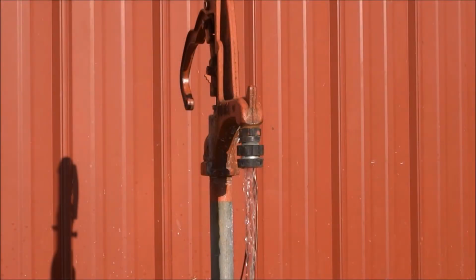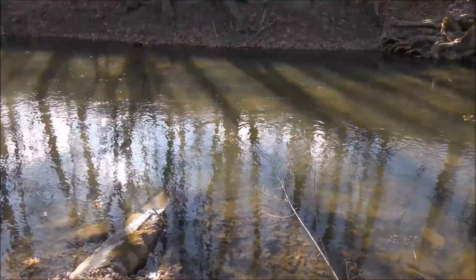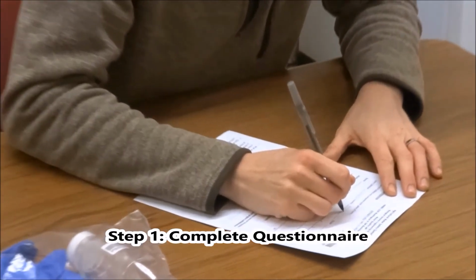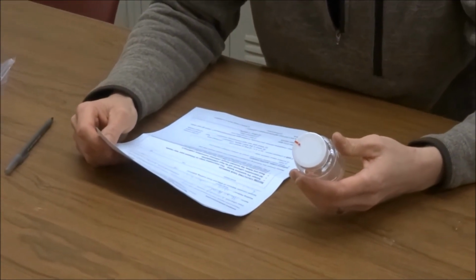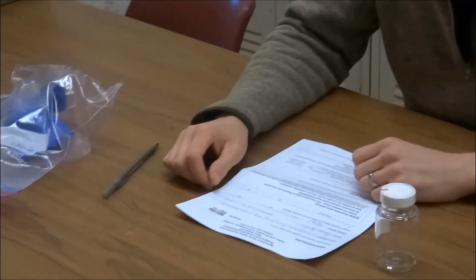Rule. In this video, we will demonstrate the step-by-step process for sampling your groundwater and surface water sources used for agricultural production activities. Completely answer all of the questions on the sample questionnaire, since this information will help the lab interpret the results of your analysis. Also, make sure the sample collection bottle label matches the numbering and identification on the questionnaire.